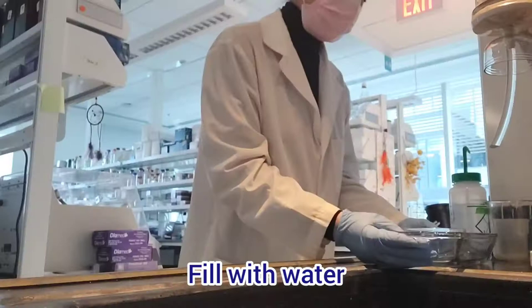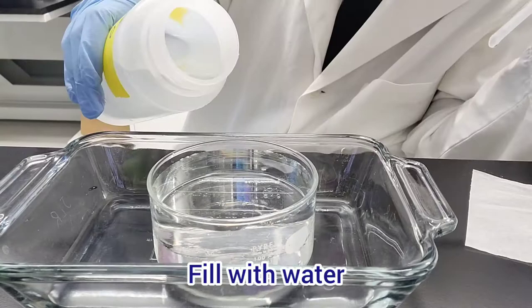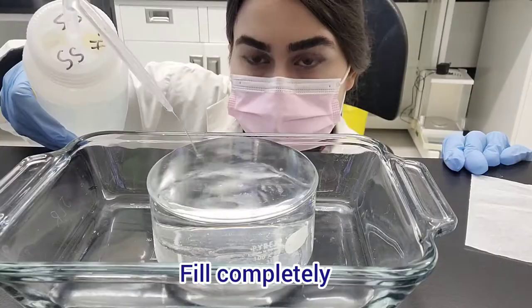First, you want to fill up the circular glassware with water and fill it completely up until it overflows, so this way you will have a really flat surface.